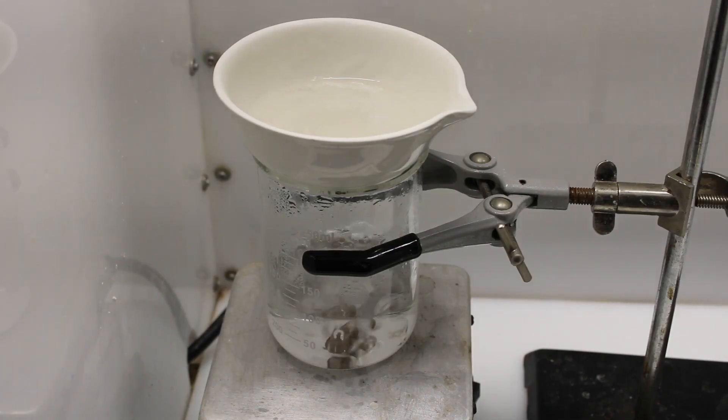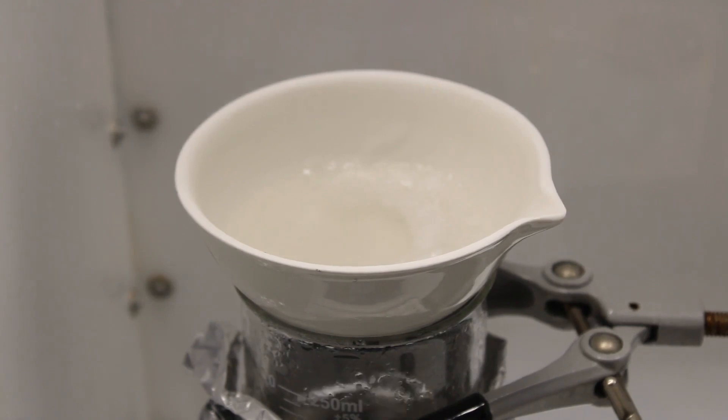Then, the solution was evaporated to dryness on the steam bath. During this time, some ammonia was formed. As such, it is advisable to conduct this step in a fume hood or well-ventilated area.